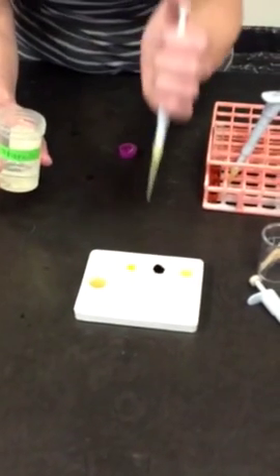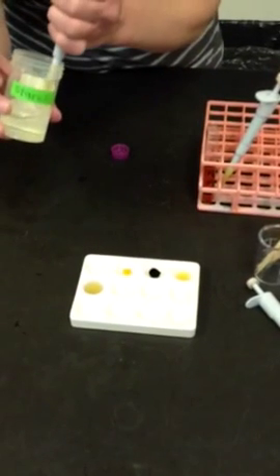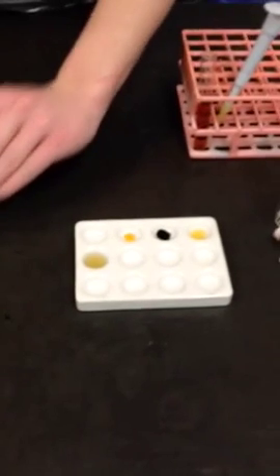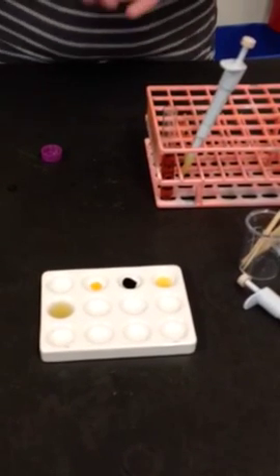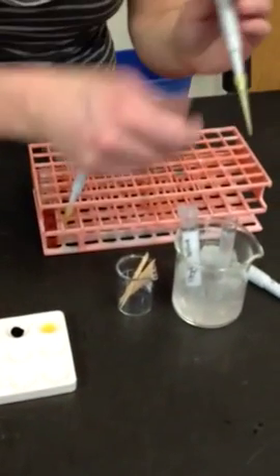So let's start with starch. I will put starch over here, and over there. I will do starch in 4 wells. The reason is that I will have 2 wells for each type of amylase. That way, when I add iodine, if it's not completely digested, I can test it again a few seconds later in the other well. So now that I have the starch, I need to add the amylase. So 1 drop of amylase in each well.